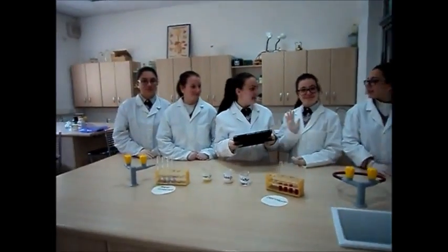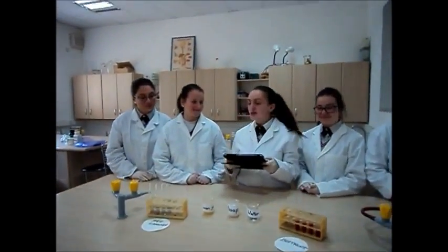Hi there science lovers, I'm Gabriela, this is Annalise and this is Abigail. And today, together with our friends Raquel and Sephora, we are going to perform an experiment about natural universal indicators.